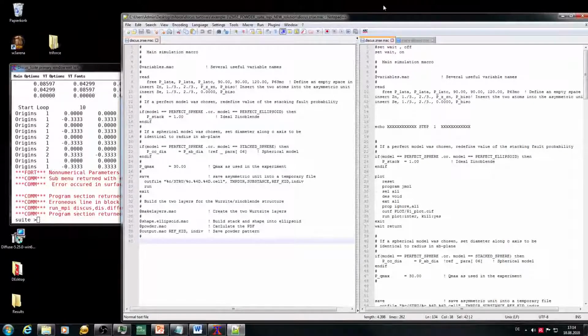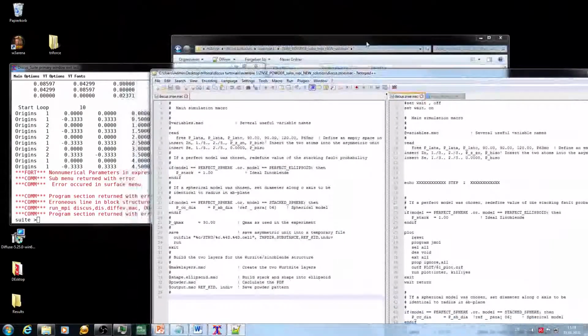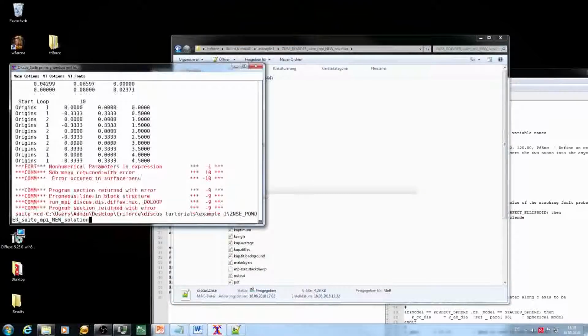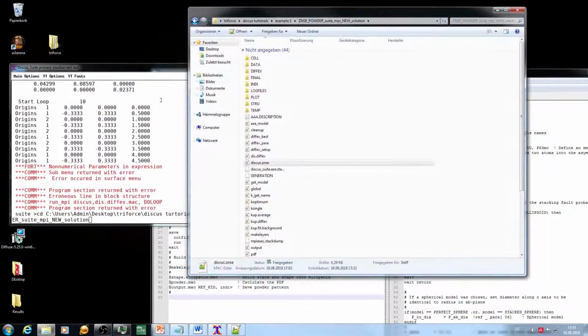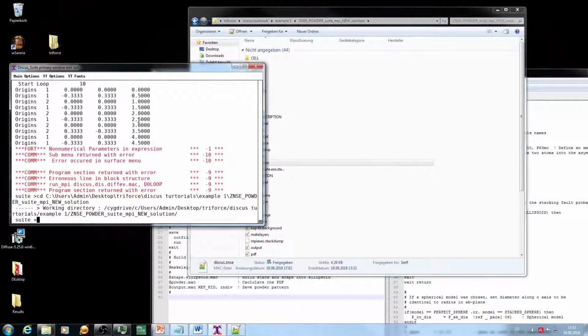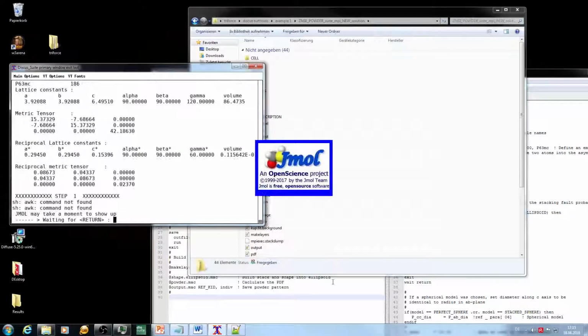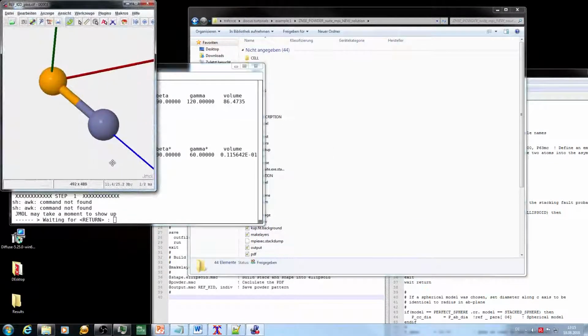So what I'm going to do now, I'm trying to use my macro, which is pretty much identical with the modified workshop version, which has the error in it, and I'll run it and pretty much the same error should come up. However, now with some plots inside.